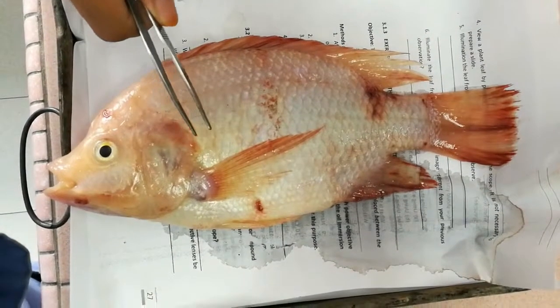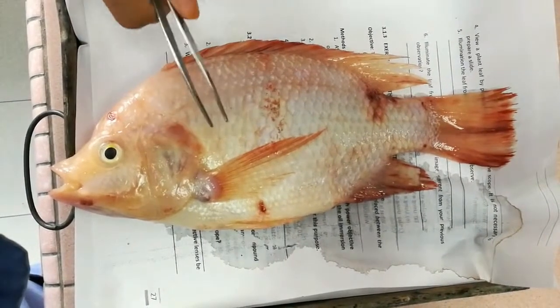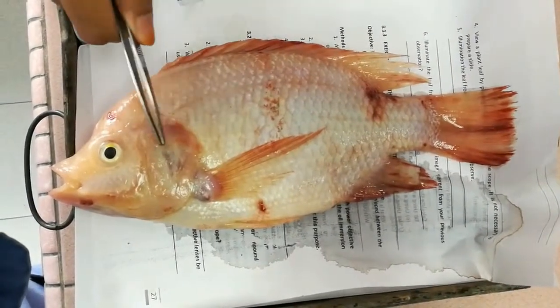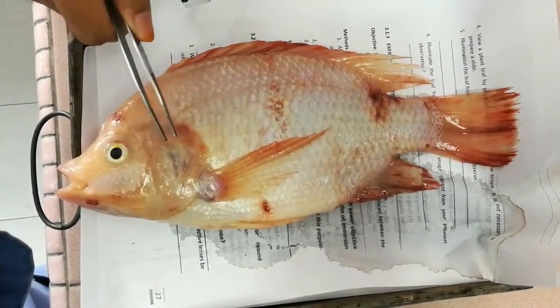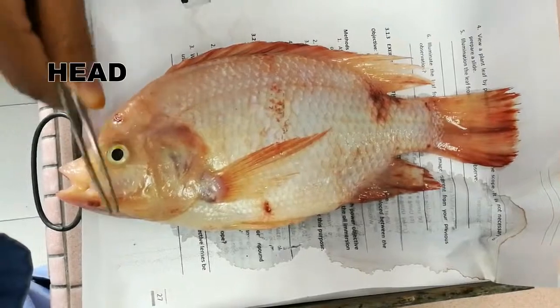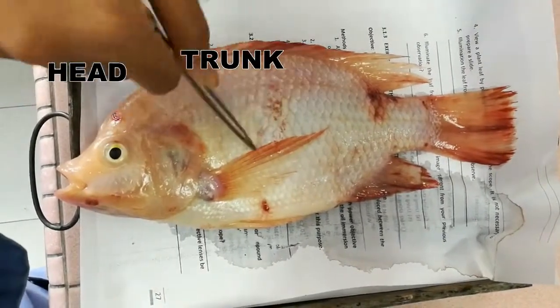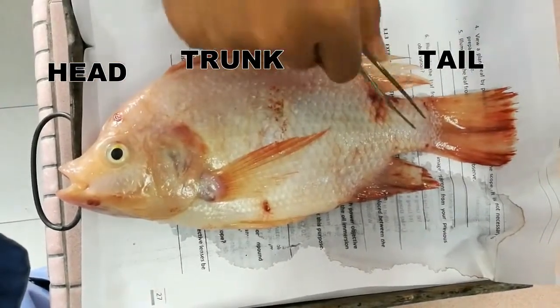For the external anatomy of a fish, firstly a fish can be divided into three parts: the head, the trunk, and also the tail.